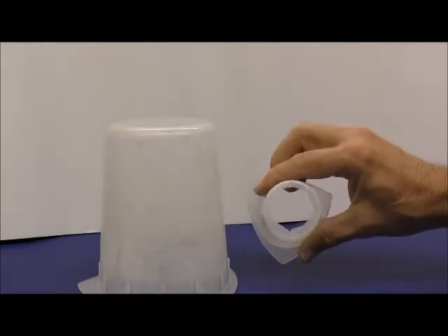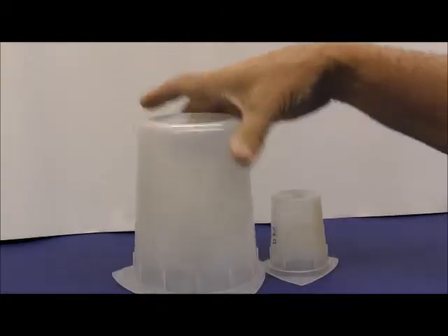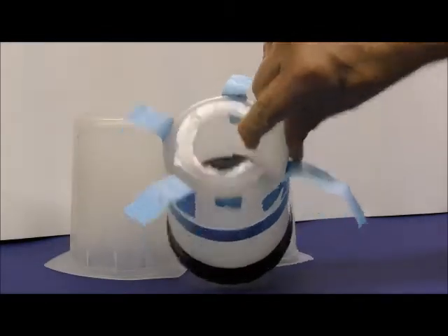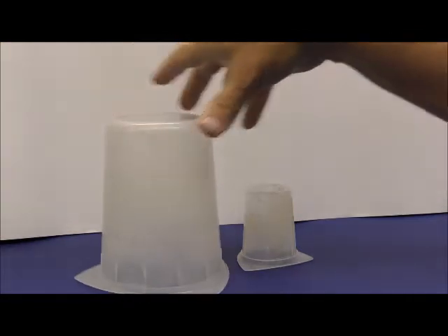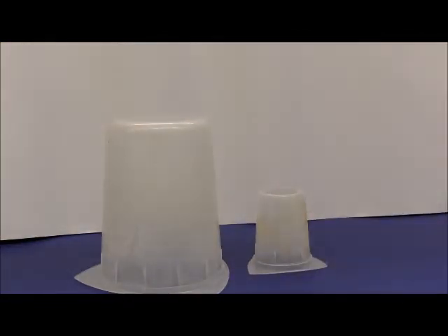And then you can make a hole in the back side like that. And you can do the same with this one, which will end up like that. It's easiest to use a soldering iron to melt the plastic than trying to cut it with a scalpel, because it usually will break or crack.